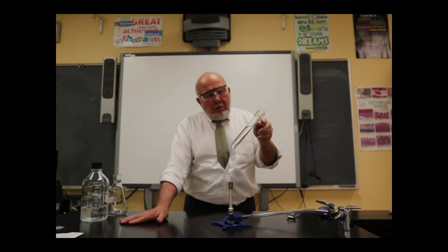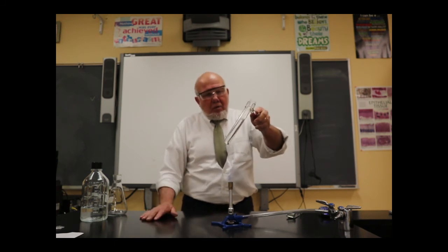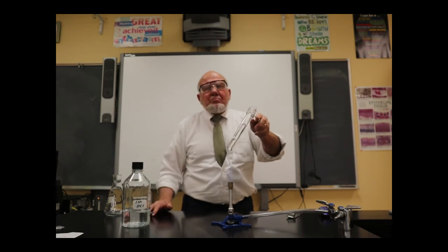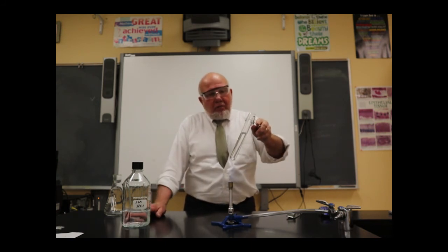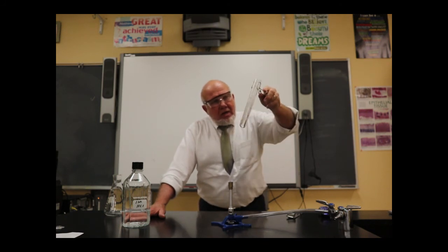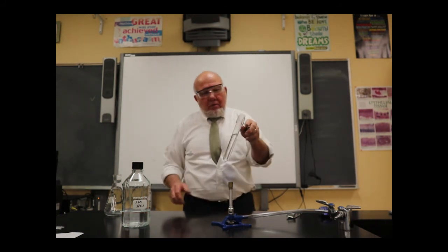Now, it would be much better, as I said, if I was doing this again, I would use a more concentrated acid, probably an acid that's 6 times stronger. When I say concentrated, instead of this 1 molar, which has 1 mole of hydrochloric acid in a liter of solution, I would use 6 moles of acid in 1 liter of solution. That would mean I'd have less liquid to evaporate off. That would take me less time. The actual reaction would happen faster, and I wouldn't have to worry so much about having this boil over. That's what I'm trying to prevent. I've got steam coming off here, but it's going to be a slow process.